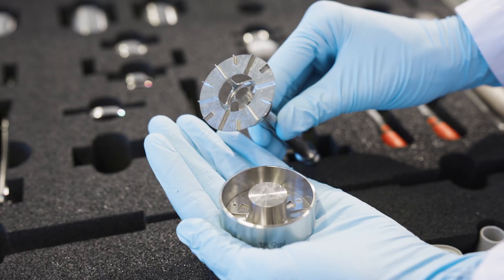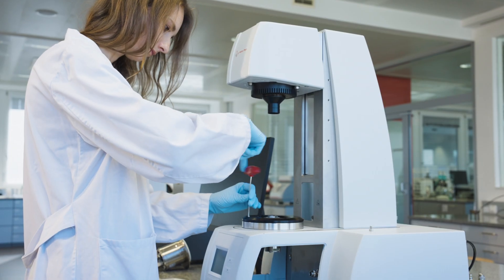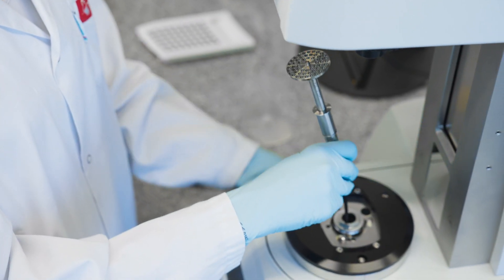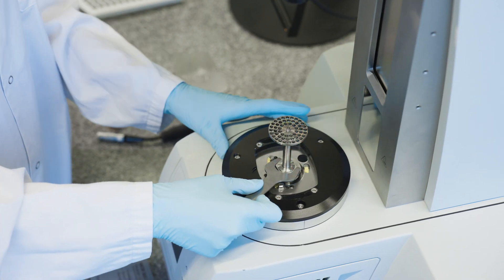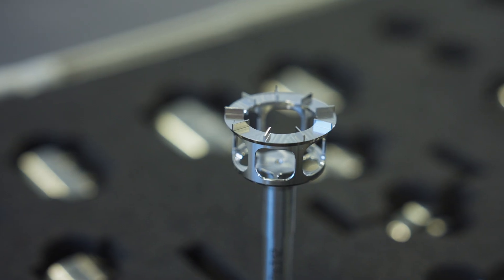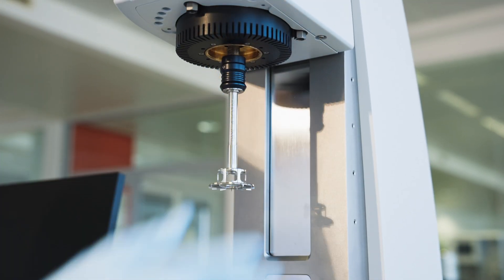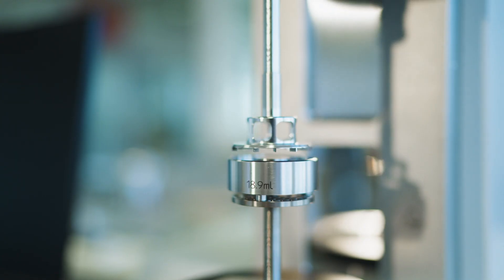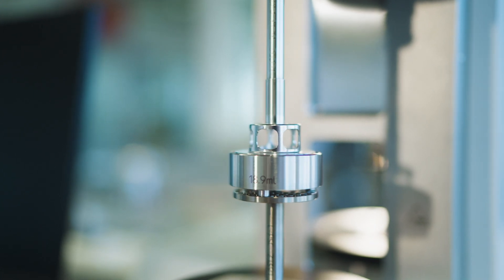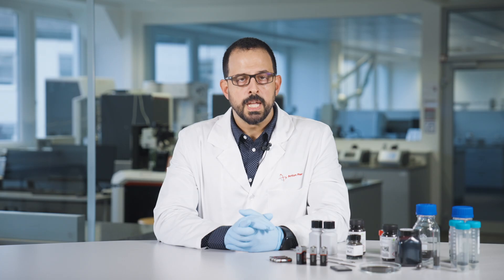For battery materials, a shear cell is more commonly used. In a rheometer, install the mounting plate for powder analysis and connect the lower shaft, which also has a temperature sensor. From the toolkit of powder shear cell, select the desired cell size and the desired measuring geometry, which will be automatically recognized by the software. Once the cell and the measuring geometry are mounted, the instrument initializes by moving the upper motor to the topmost position, then slowly lowering to determine the zero gap, or zero millimeter position.